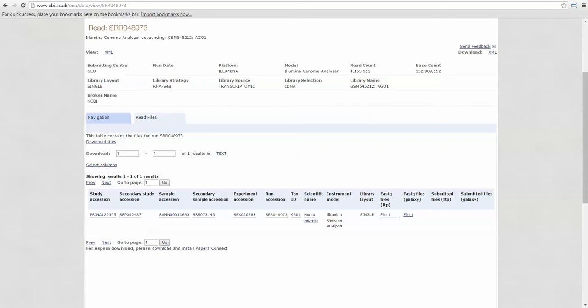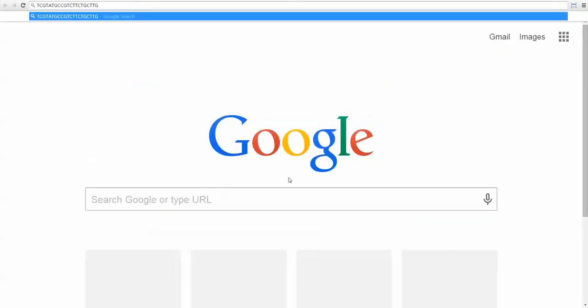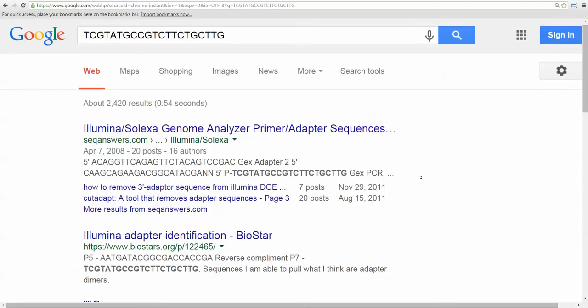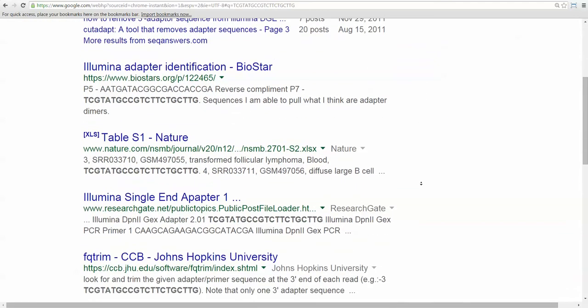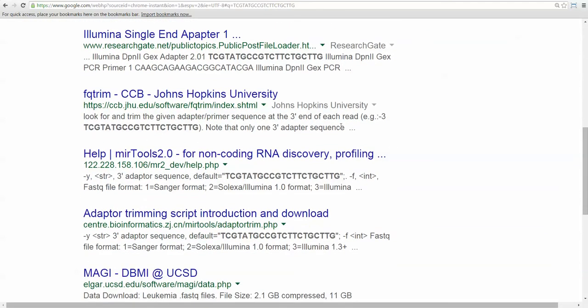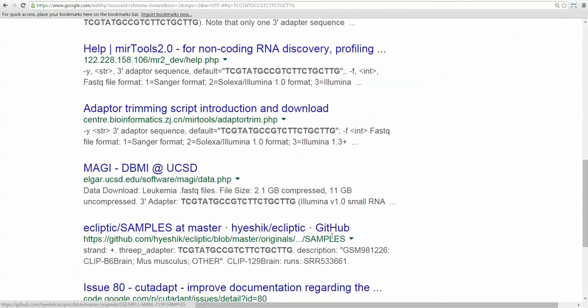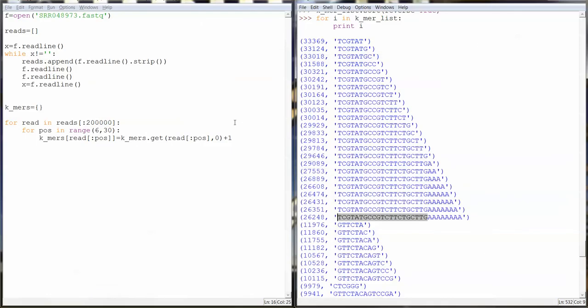So we can go back to Google, type in that sequence, and look at that. We get a bunch of hits with adapters, 3' end, 3' adapter. So it's pretty clear that with basically really just this code right here, we were able to find the adapter sequence for this data set. This technique should work for most small RNA-seq datasets.